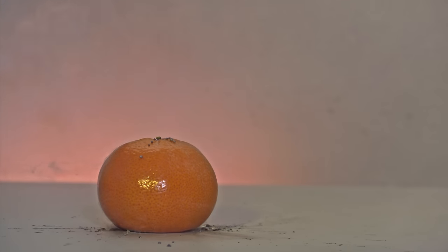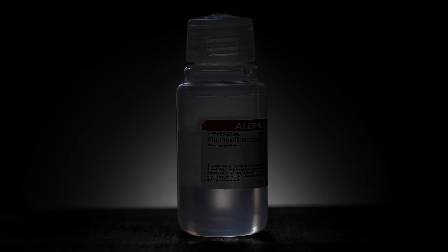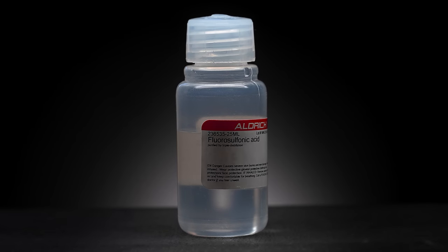Well, it was definitely necessary to include a reaction with some kind of acid. This time I chose fluorosulfuric acid.